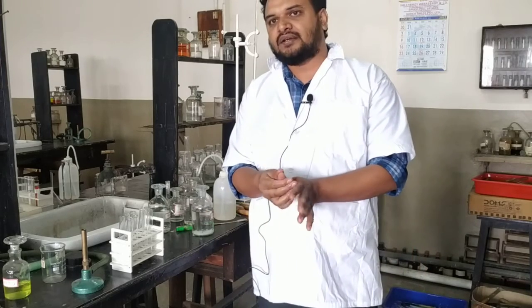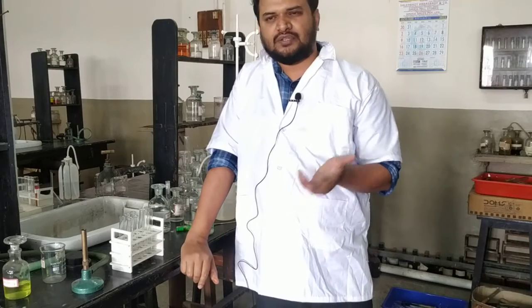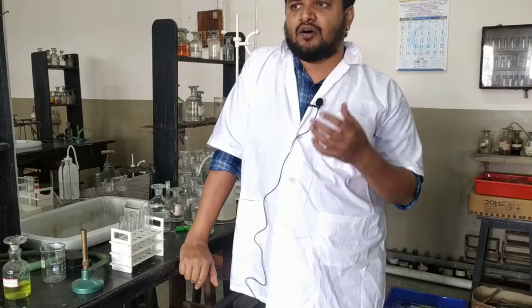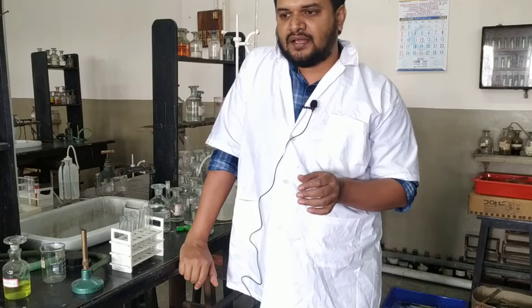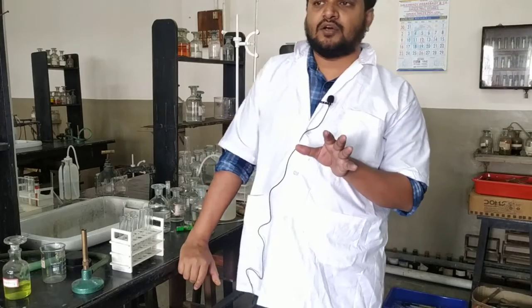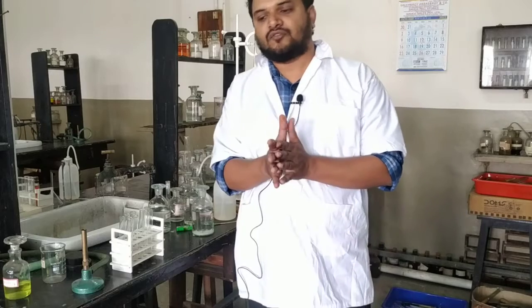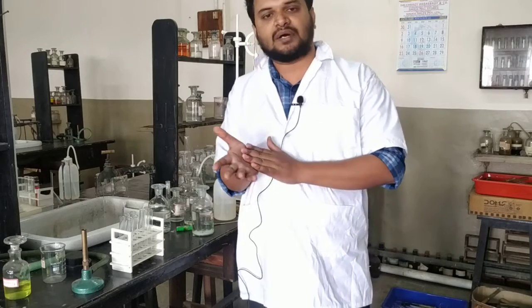In the anion part, there are some preliminary tests like heating with dilute H2SO4, where you get some observation, evolution of some gas with characteristic smell or characteristic color. From there you get some inference. Then we do heating with concentrated H2SO4, there also we get some inference. From there we get an idea what anion it can be, but the anion can be confirmed only with sodium carbonate extract. So how can we prepare sodium carbonate extract?